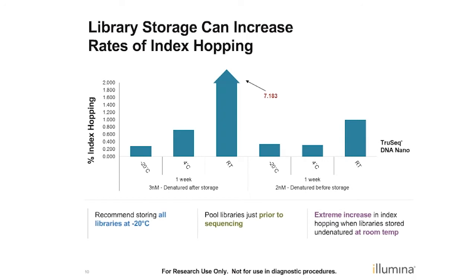So this is an example of how library storage conditions can alter and increase the rates of index hopping. These are some experiments we did where we took libraries, these are actually nano, so these are PCR plus libraries, and we left them 1 week of storage at -20 degrees, 4 degrees, or at room temperature, and this is denatured after storage or denatured before storage. And what you can see is that actually this bar here goes all the way up to 7.1% index hopping. So storage of undenatured libraries at room temperature can lead to very high levels of index hopping. I doubt if anyone stores their libraries for a week at room temperature, but basically I think you can see the trend that keeping them at -20 degrees is by far the safest way to store the libraries.